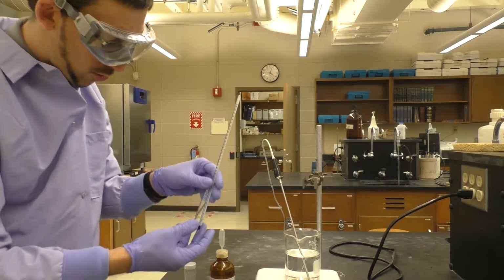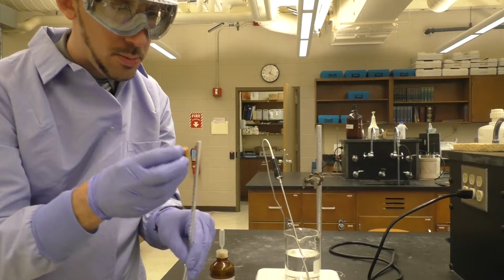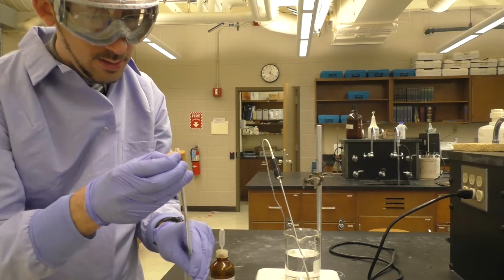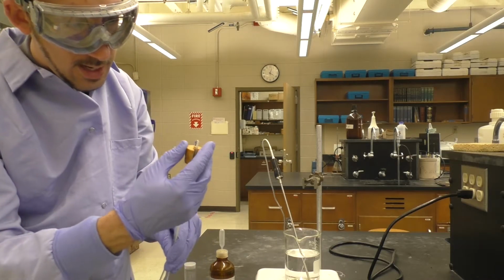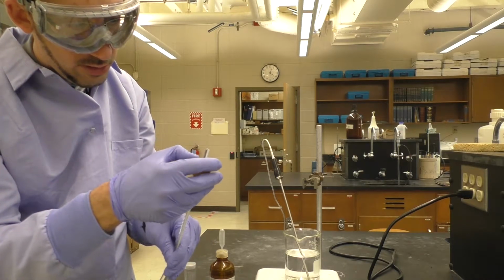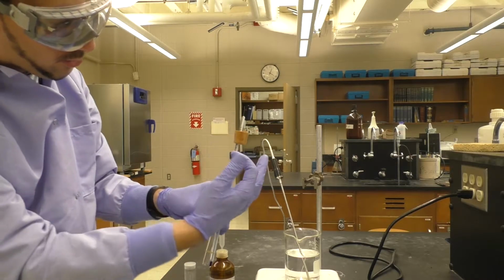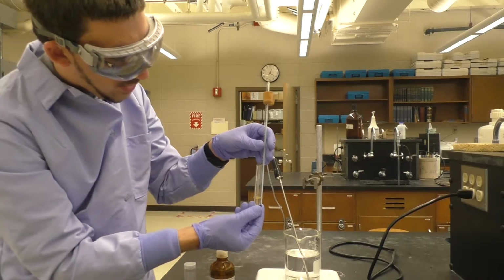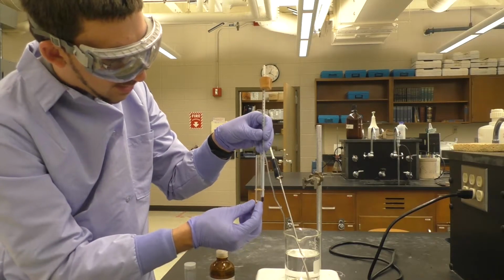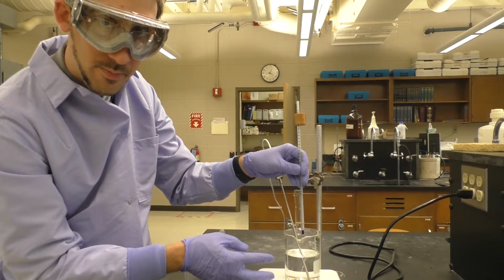Then what we'll do is you'll want to take this and take the rubber piece. You can put the thermometer through that, generally on the inner hole here. And now you'll want to adjust this to a point where it's convenient to then clamp onto the rubber piece right here so that it will hold the thermometer and test tube suspended in the water bath.